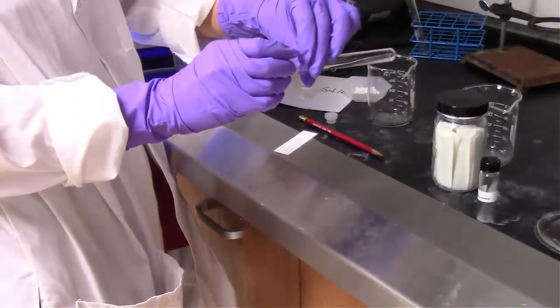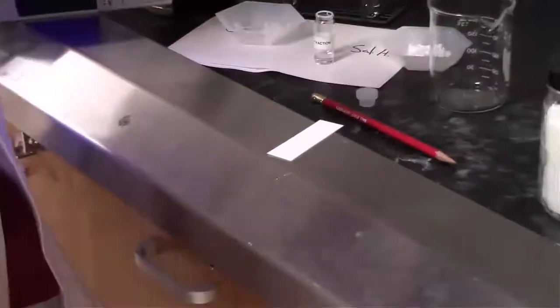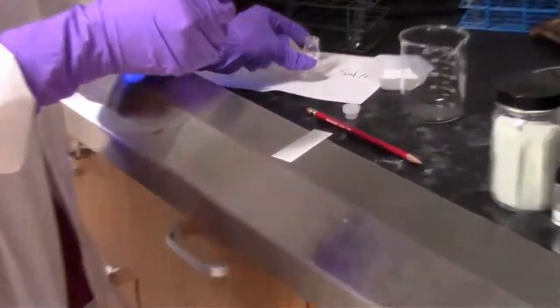We're getting some of the dissolved caffeine, and we are going to spot that on the plate. So with these micro capillary tubes, we've got 2 open ends on them. We're just going to dab that down onto the plate, and liquid is going to run out onto the silica gel. It looks like that was slightly overspotted. Also, since that line was drawn so sharply, a lot of the liquid basically flowed into that little area where the pencil line was that's just plastic, so it couldn't spread evenly through the silica gel.